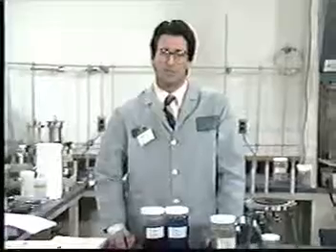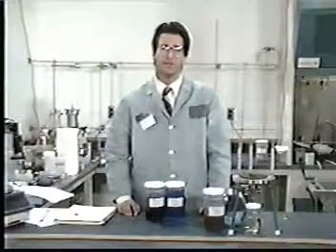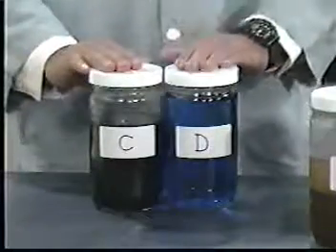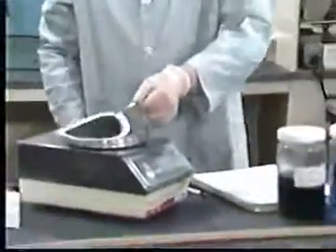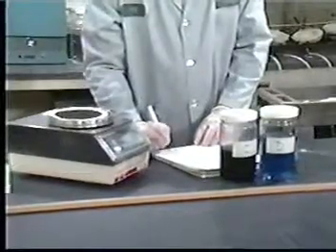Bill will demonstrate what to do if the sample appears to be composed almost entirely of liquid material. We'll determine the percent dry solids for waste C and D. Remove the solid phase and filter from the filtration device. Dry them at 100 degrees Celsius until 2 successive weighings yield the same value plus or minus 1%, and record the final weight. Recall that we pre-weighed the filter for use in the percent dry solids determination.